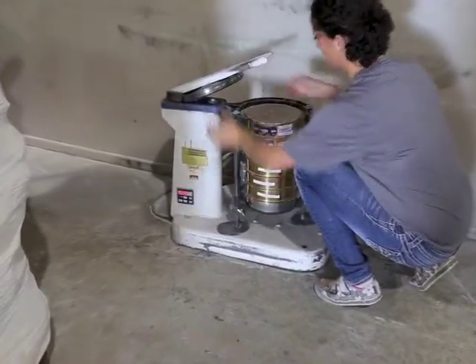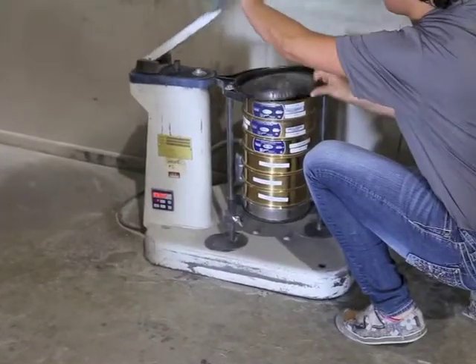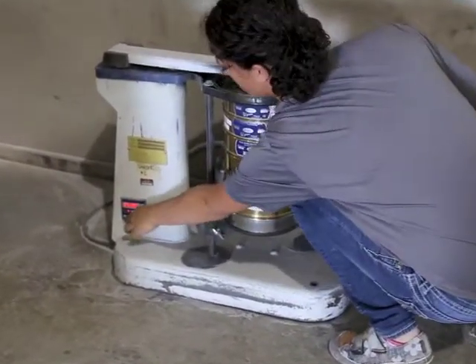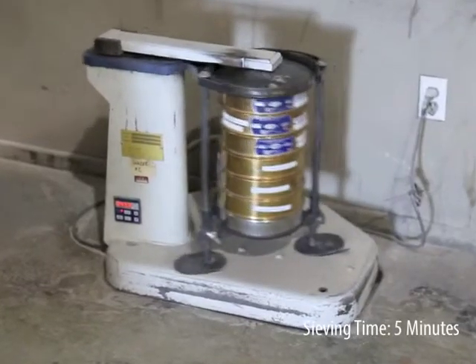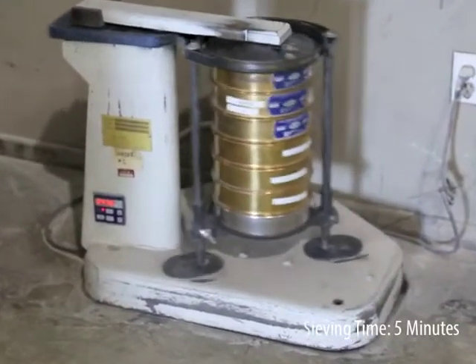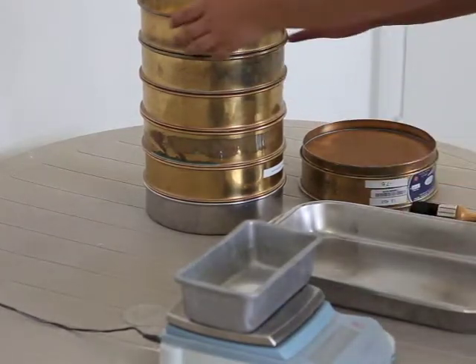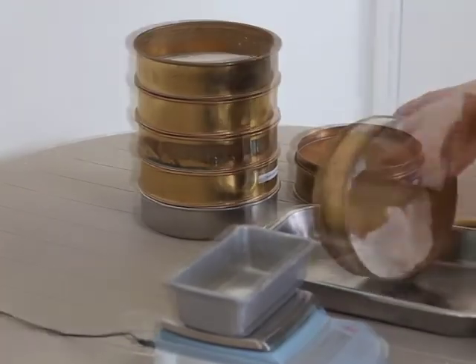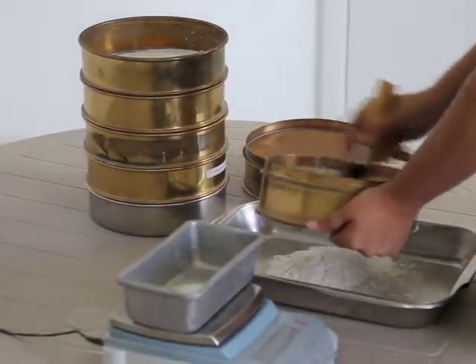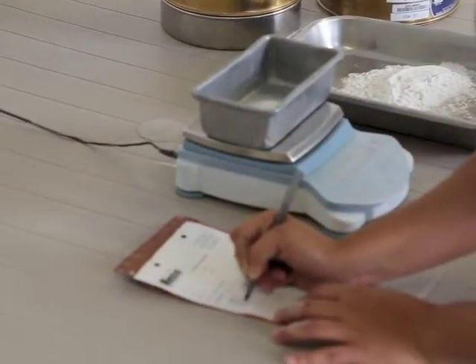The sample shall be separated into a series of sizes using such sieves as are necessary. The sieving operation shall be conducted by means of a Tyler Rotap sieve shaker or equivalent. Sieving time shall be 5 minutes, after which the weight of each sieve fraction shall be determined on the balance or scale and recorded.